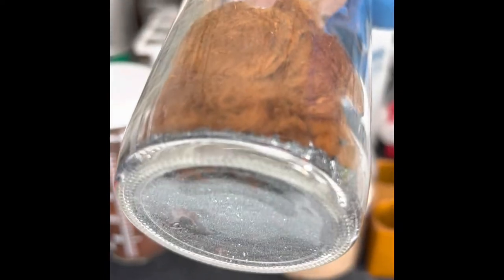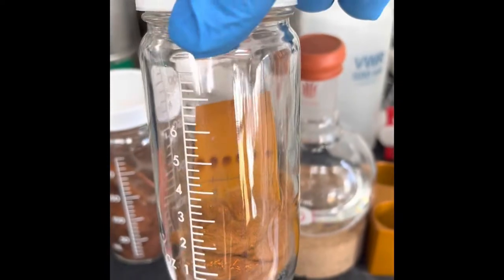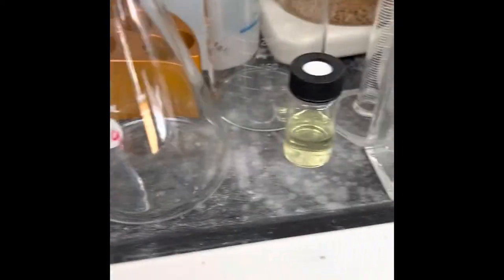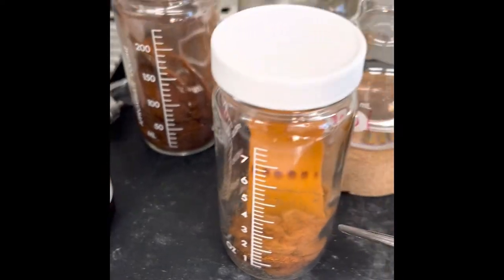How to make this? Take some iodine in this kind of bottle, then use some cotton. Once you've done that, seal it in the chamber, dry it, and put the plate inside this tube.